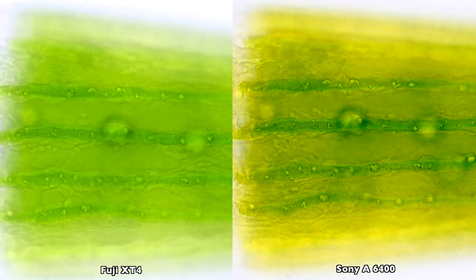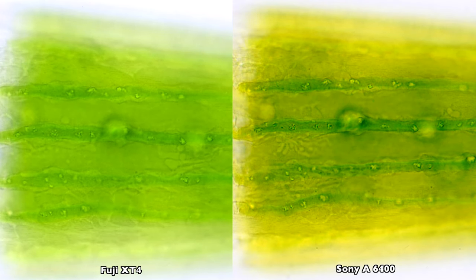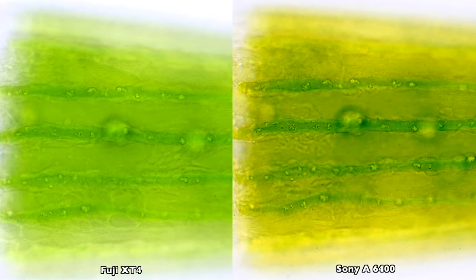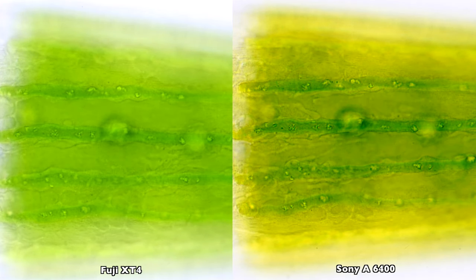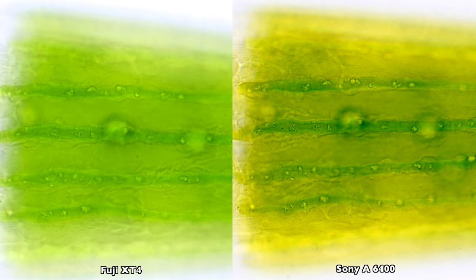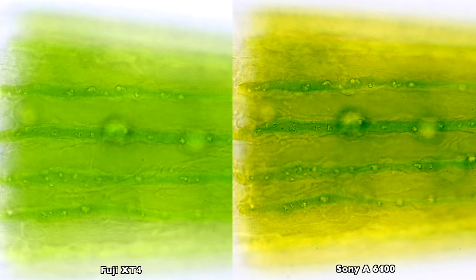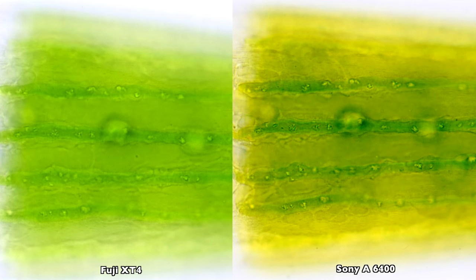Okay, so let's compare it directly. What you can see here on the left side is the Fuji camera and on the right side, it's the Sony camera. And you can see right away how different the colors are. By the way, the footage has not been altered in any way here either. But unfortunately, the Fuji camera doesn't render the details as well as the Sony camera.